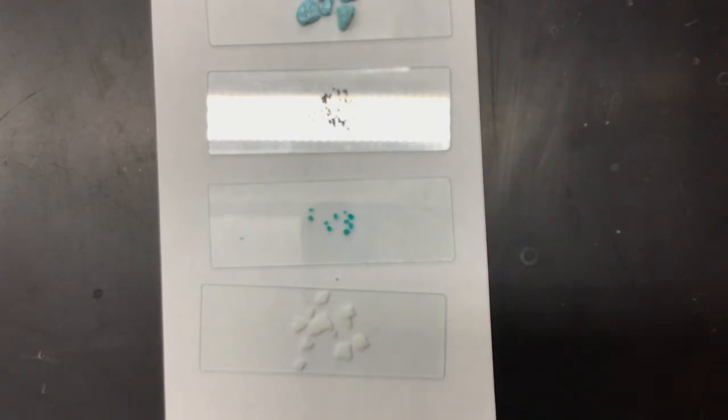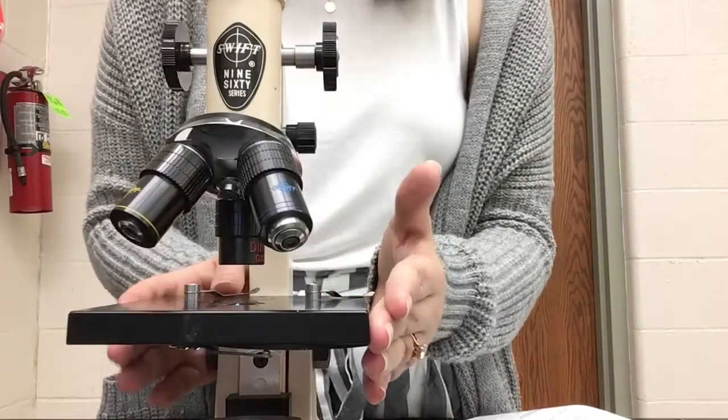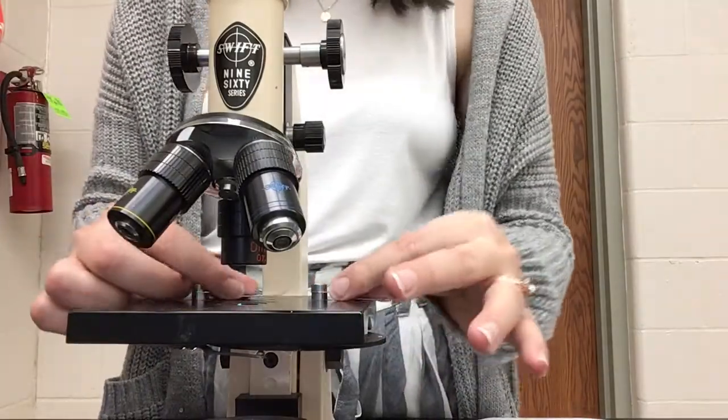All right, so now that I have my slides prepared, I'm going to put these under the microscope. I'm going to attach photos. Hopefully they're clear to see, but if you're having a difficult time seeing them, please let me know. I will skip ahead for that. I do want to show you what I'm working on with the microscope so that it's easier to tell.